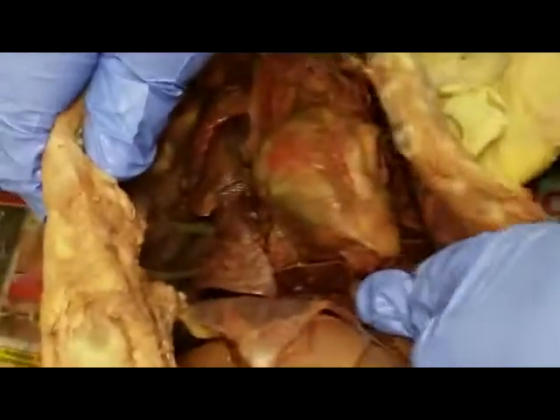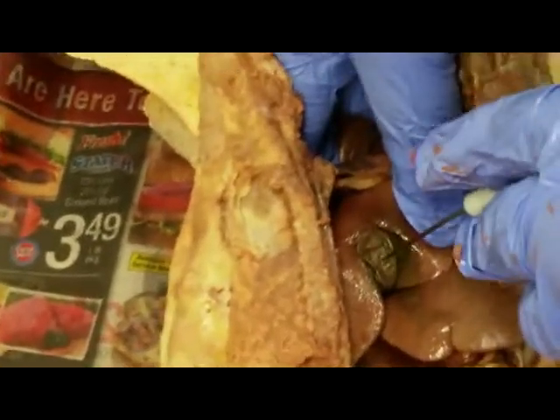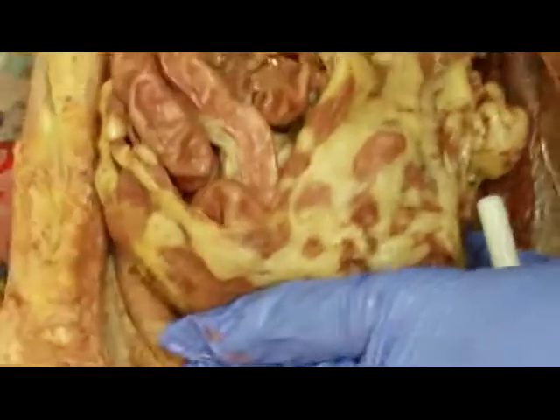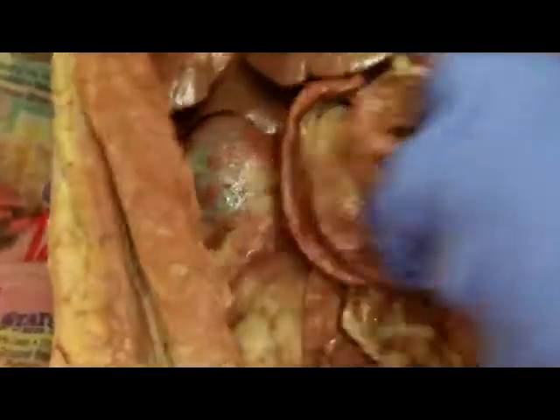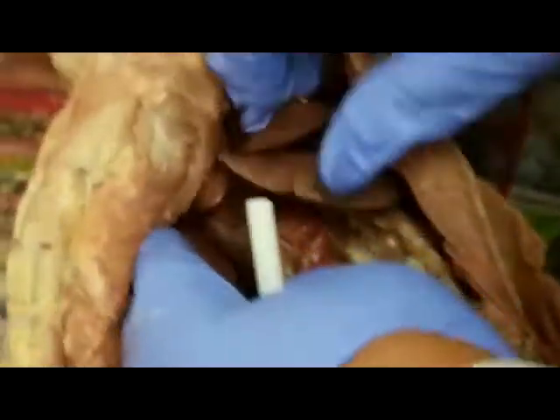Now the diaphragm. And here is the liver. And this represents what? Gallbladder. And now all of this is small intestine. And the fat, this is the omentum, the greater omentum, where I said fat collects in there. And now here, what I want to point out to you is that here is the stomach.